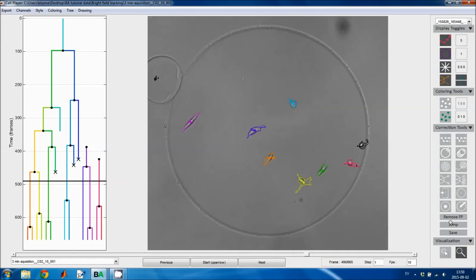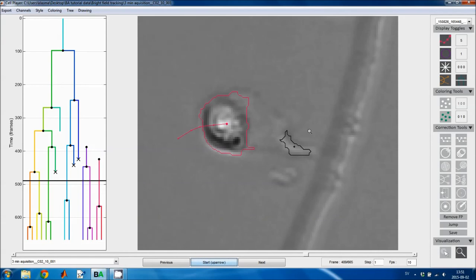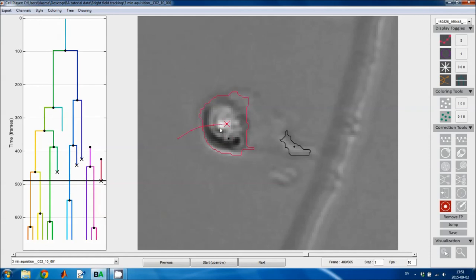And the three last tools here, the first of them removes false positive tracks without segments. So if you have point objects which are considered false positives, you remove them by pressing this button. Now this will be removed. Oh, this probably has an outline. Yes, it did have an outline, but if I create a new cell here and delete it, then it can be removed by pressing this button like that.